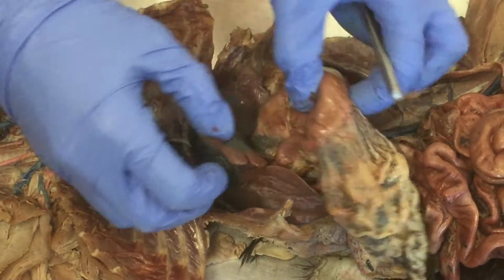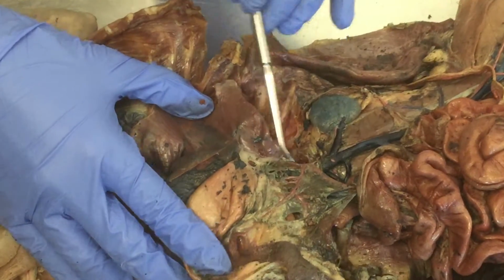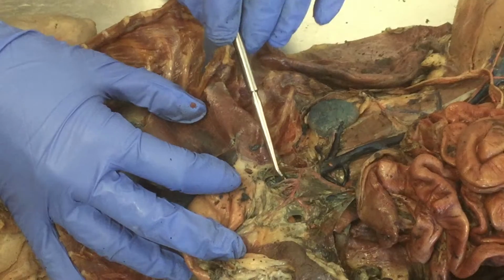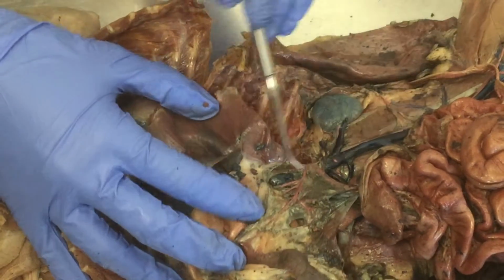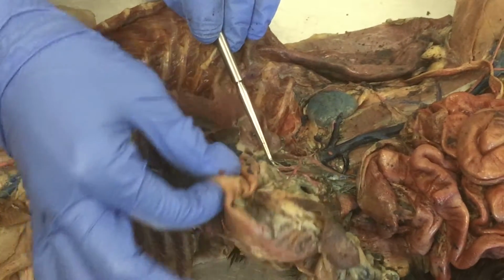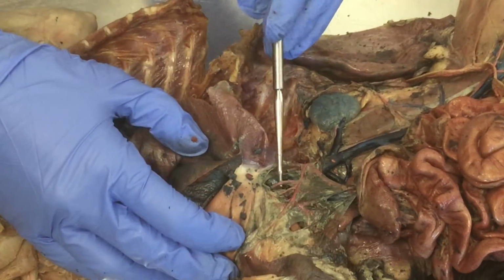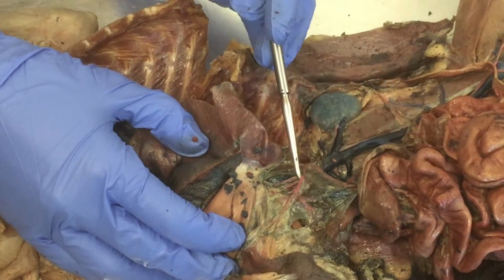And then just inferior to the liver is the stomach, all right? So the hepatic artery tends to dive posterior, okay? So it's going to dive back and then up towards the liver. And then left gastric is a little bit more superficial because the stomach is closer by. So hepatic, left gastric, splenic.